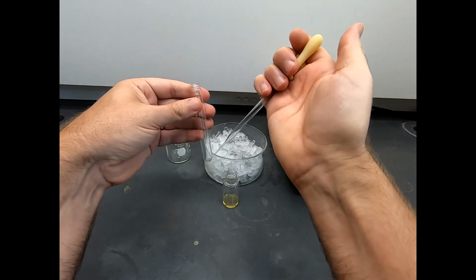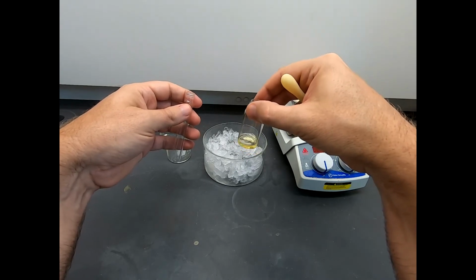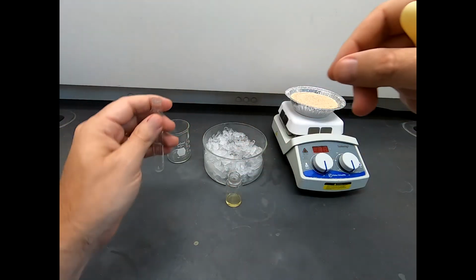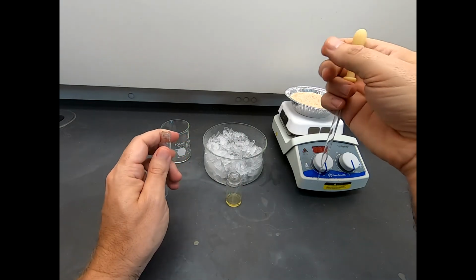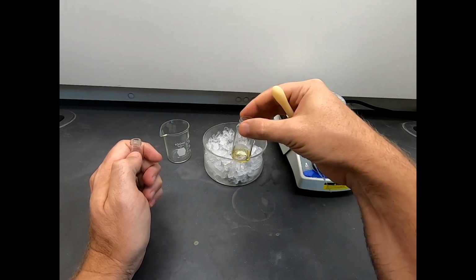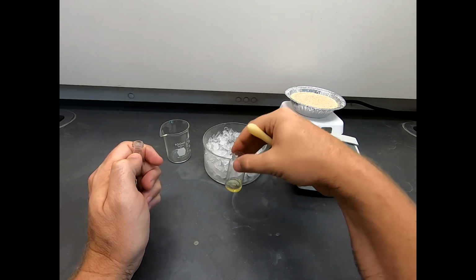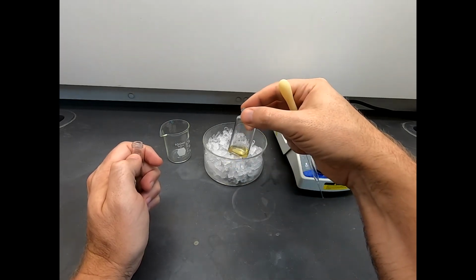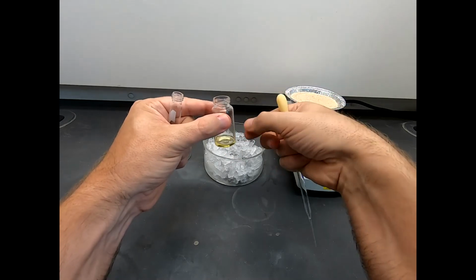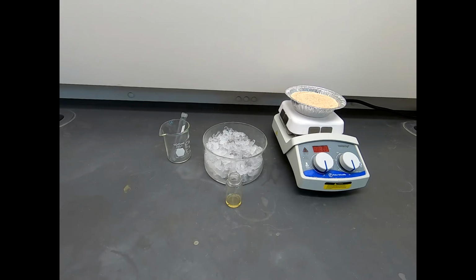Now I don't want to use too much ethyl acetate because eventually I am going to add hexane to this. So now we're up to probably close to 2 milliliters, and the procedure technically calls for about a 3-to-1 ratio of hexane to ethyl acetate. So if I have 2 milliliters of ethyl acetate in here, I'm going to need 6 milliliters of hexane to get a 3-to-1 ratio. And I've just got a finite volume, so just be mindful of the volumes you're using, and if you're doing a rinse, make sure you use a rinse-sized portion, not a huge portion.